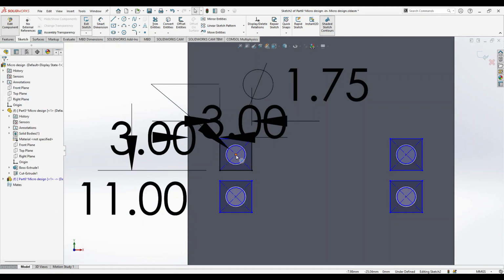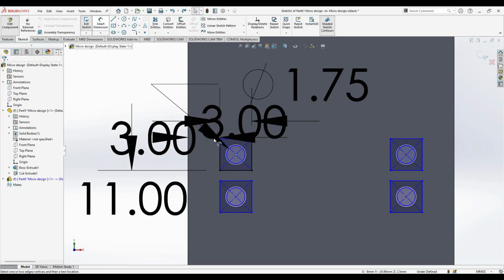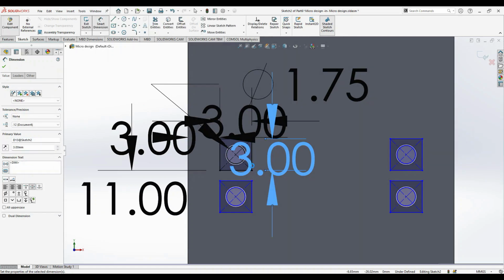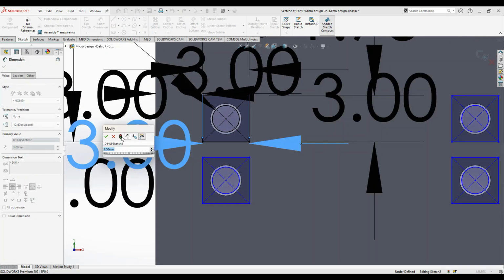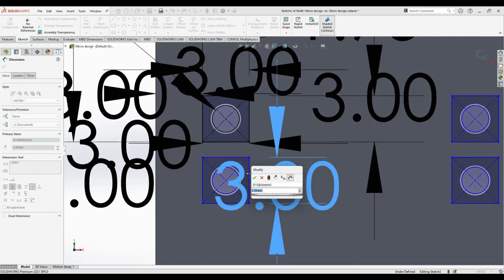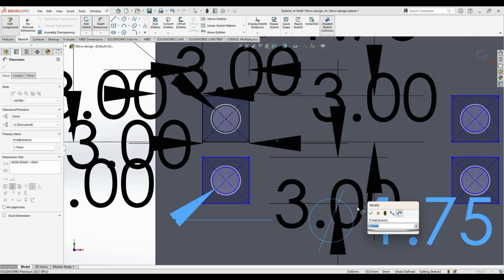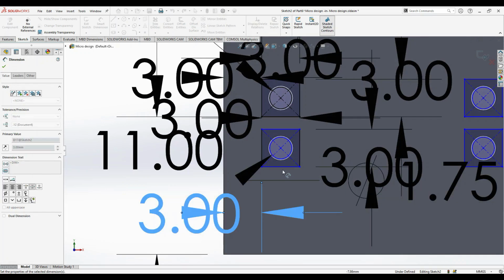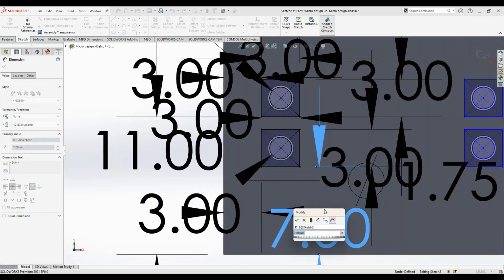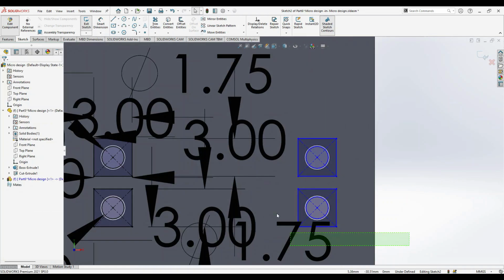And we see that this length is missing. What we do is, so this is fully defined. Now again you can do the same thing. 3 mm × 3, and this is 1.75. Now again you can just specify it as 3, and this distance is 7. It's done. So instead of giving the same to this, just delete this.